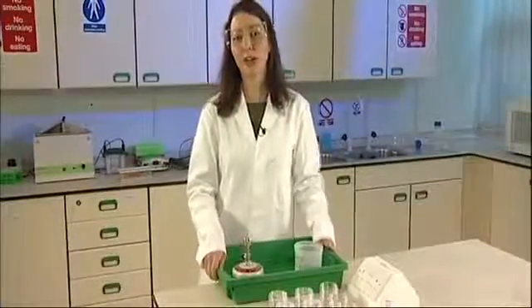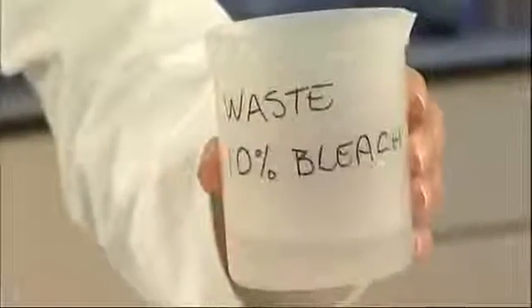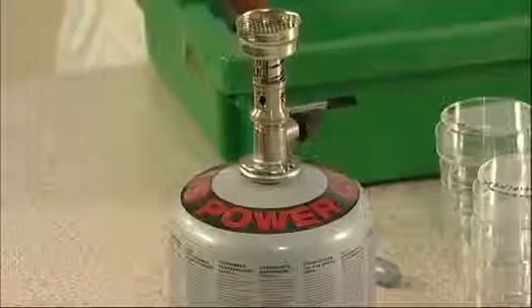Aseptic technique should be used when pouring agar plates. For this you'll need a 10% bleach solution, and you may wish to use a Bunsen burner to prevent any airborne contamination.